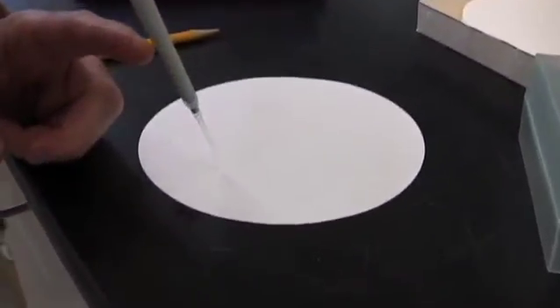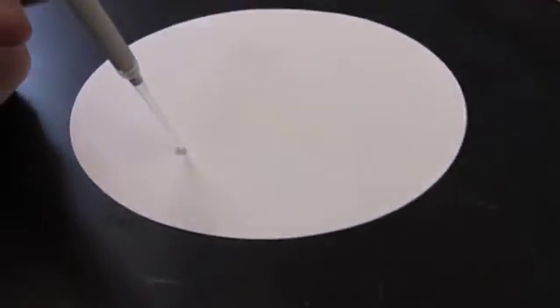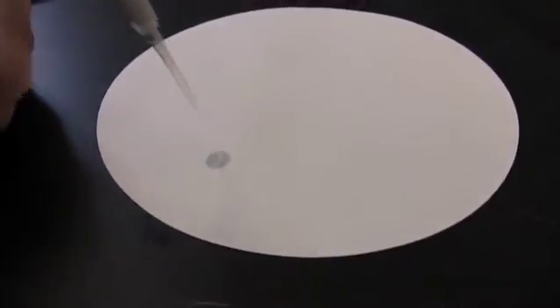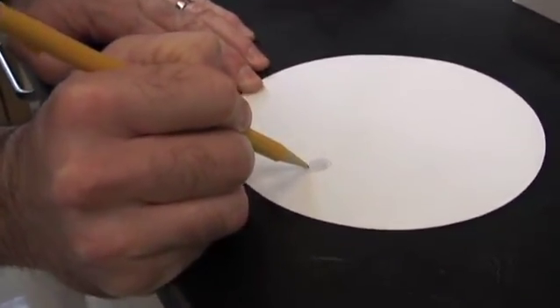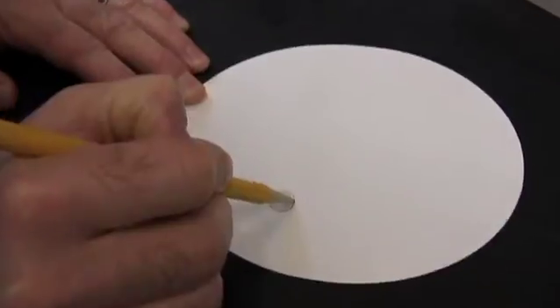You just want to place the DNA on the paper, and then while it's wet, draw an outline of the DNA, because once it's dry you won't be able to know where it was.